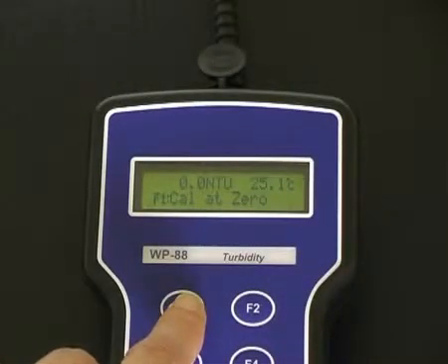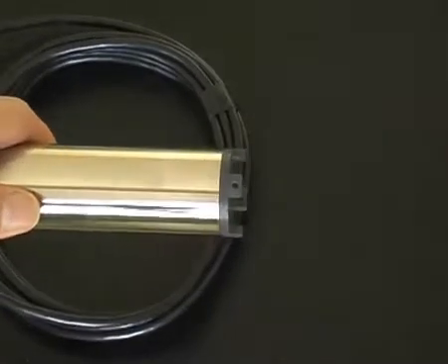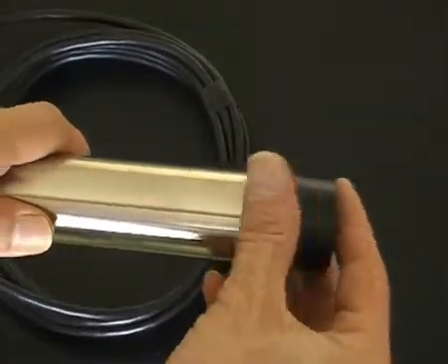For turbidity sensor storage, simply replace the protective black cap on the end to protect the optical windows.